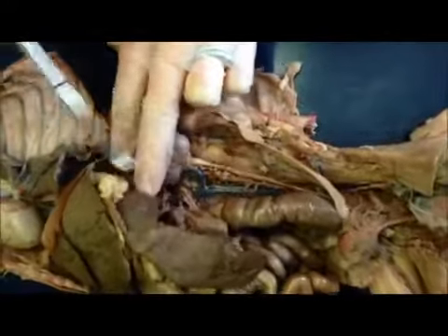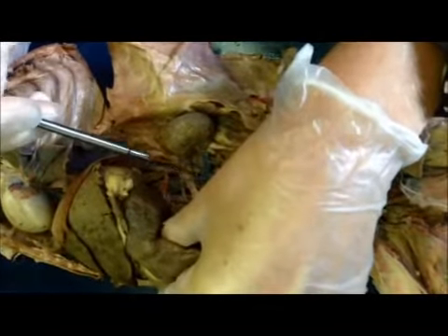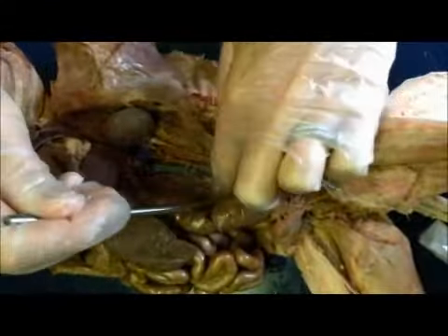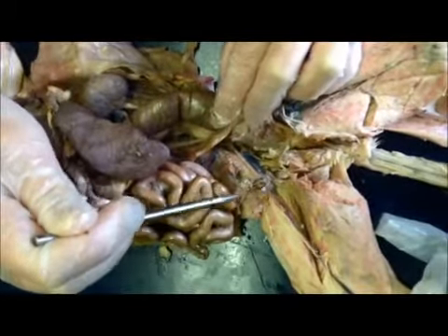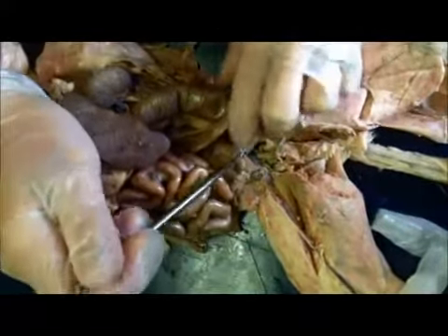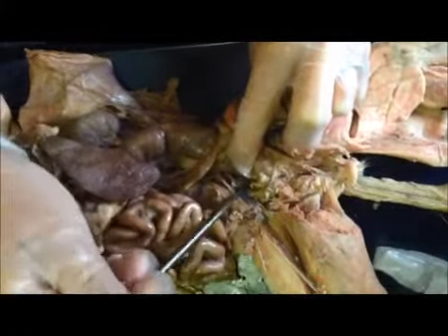We have the inferior vena cava that comes down from the heart. It goes out, and you've got the adrenolumbar vein right here across the adrenal gland. Then we have the renal vein that goes out to the kidney. Continuing down, we have a split right here, and you've got the common iliac vein right here. And then going down into the external iliac, down into the femoral vein. Right here, you've got a split, it goes down to the caudal, which is in the tail, but you've also got the internal iliac vein on both sides.